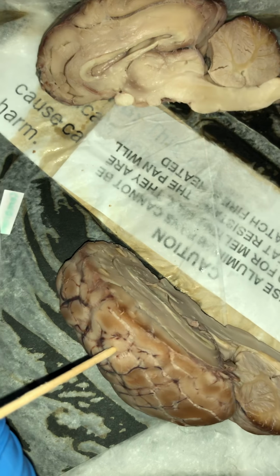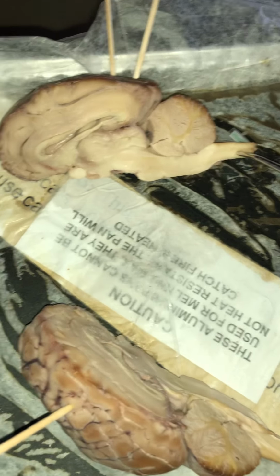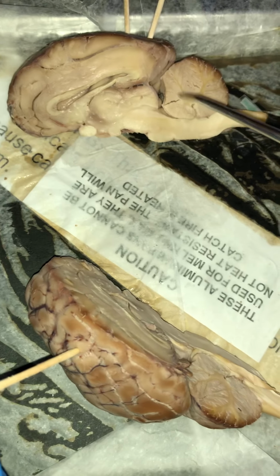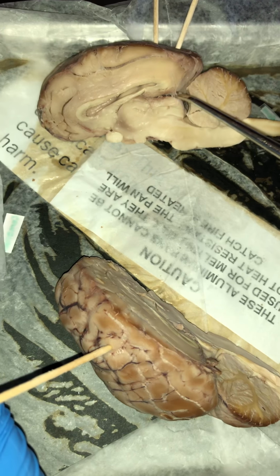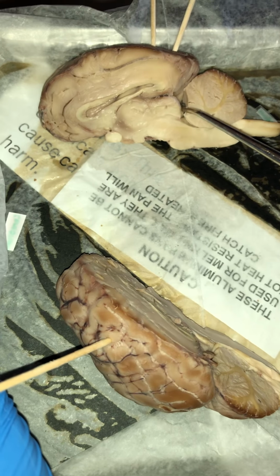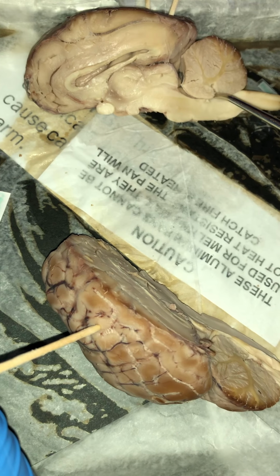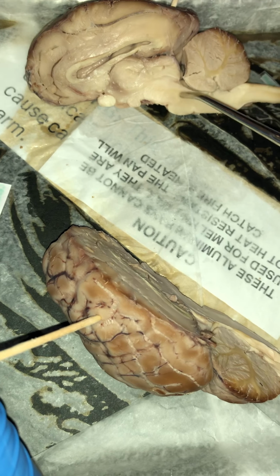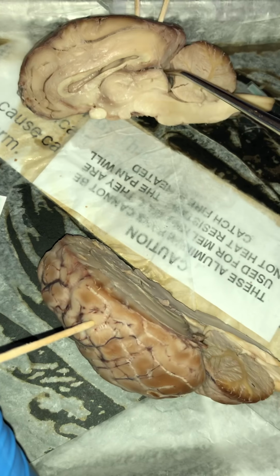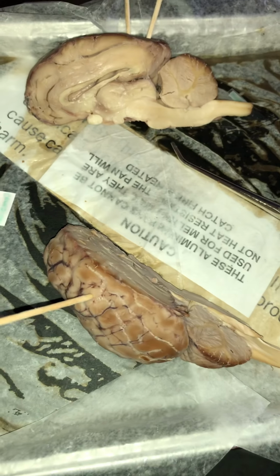Going on from there, we have what is known as gray matter. Gray matter is area of the brain and spinal cord containing cell bodies and dendrites and things of that nature. Going on from there, we have what is known as the cerebral aqueduct, which would be this whole area going from there to there. The cerebral aqueduct is basically what is connecting the third and fourth ventricles containing the cerebrospinal fluid. This right here is the fourth ventricle, and this right here is the third ventricle. And going down these channels is basically what will be known as the cerebral aqueduct. And this concludes my video about the sheep brain anatomy.